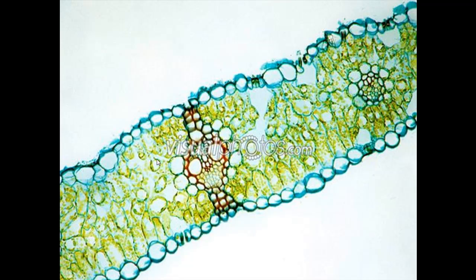Alright, here's another one, a little bit different. We've got the epidermis either side, and it's stained quite differently, so that's quite nice. Can't really make out the palisade and spongy. I think the palisade's actually on this side, on the lower side, so maybe we're looking at things upside down. But these look a little bit more rod-shaped or regularly arranged to me, and on this side it looks like there's a bit more air space. But I'm not 100% sure, so on this one maybe I'd just label this mesophyll rather than separate into palisade and spongy.